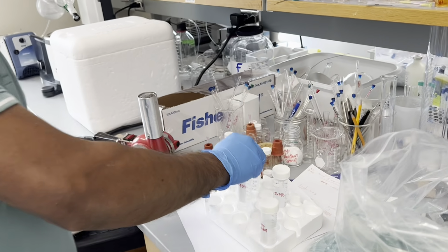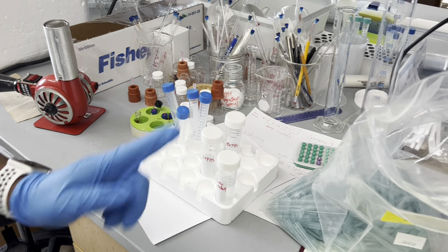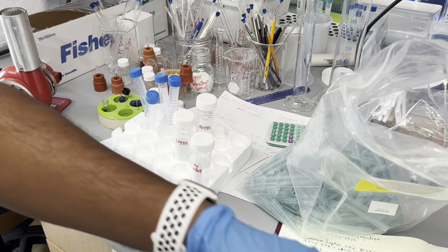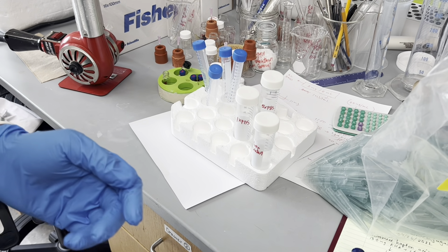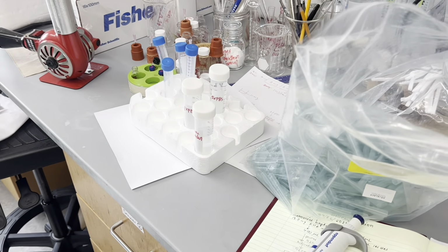What we are using here is phosphate buffer, because this buffer pH is around 7.4, and our target is to keep the solution always at 7.4, because biological systems need the buffer pH 7.4. You understand? Okay.